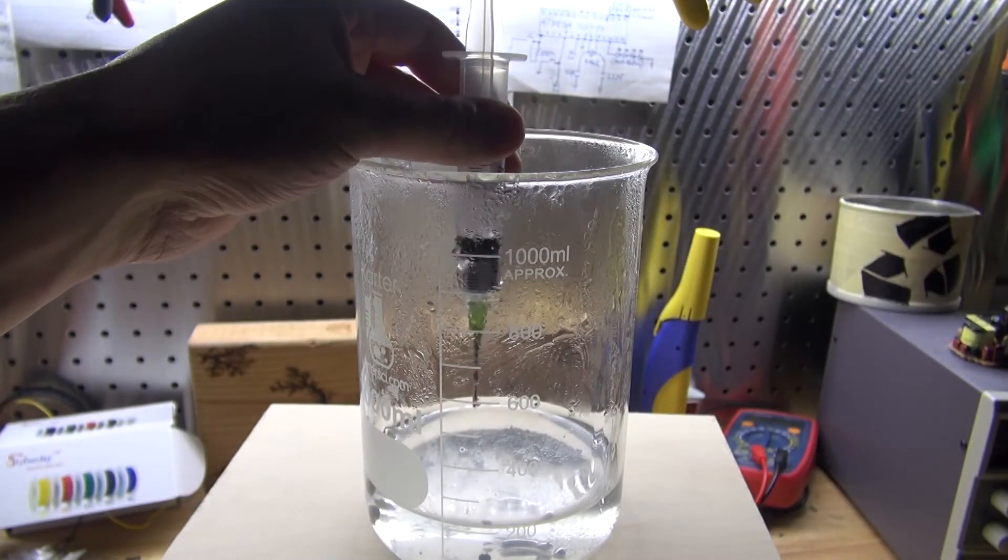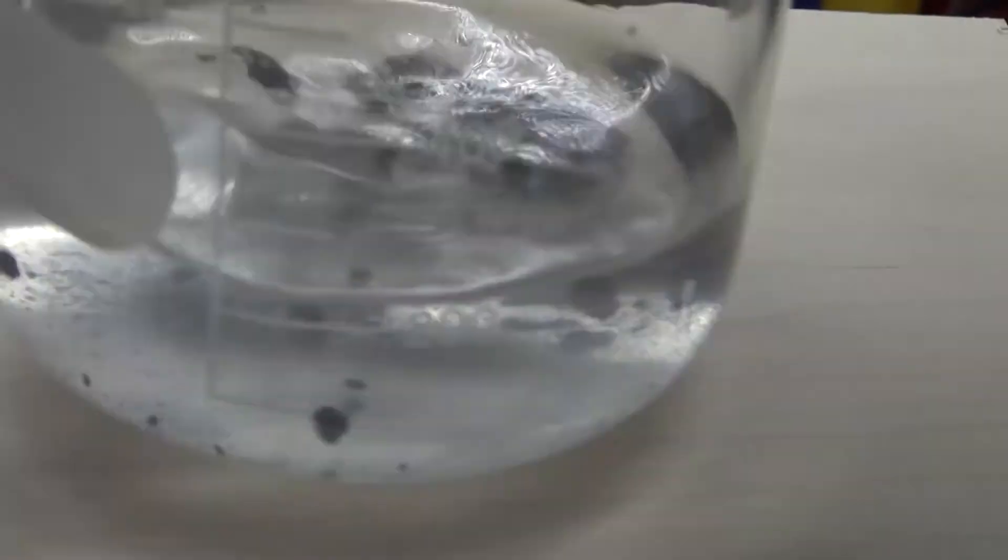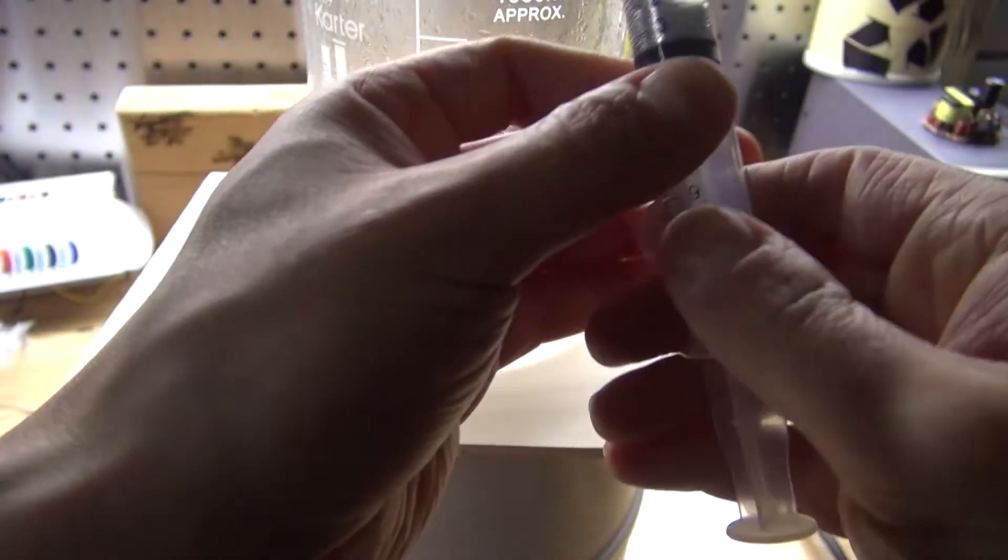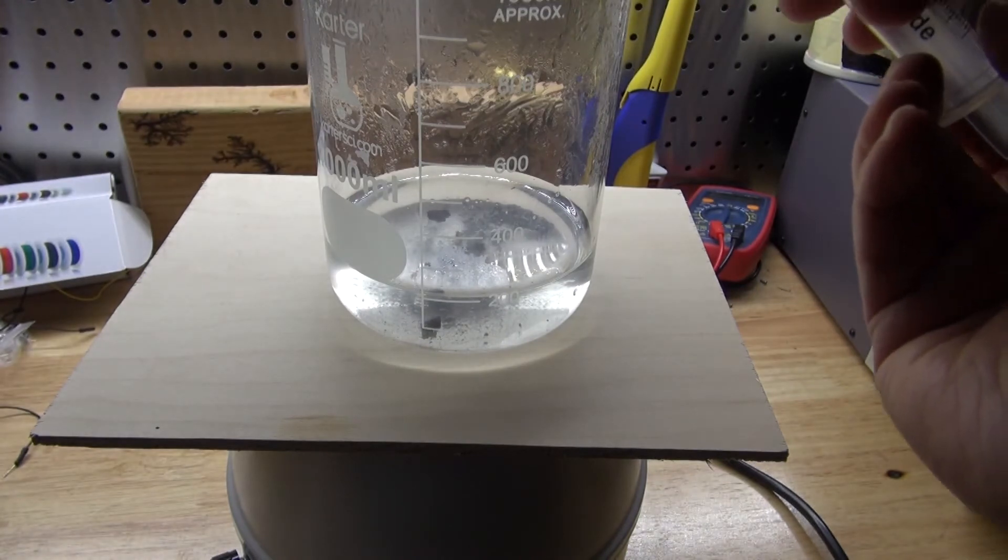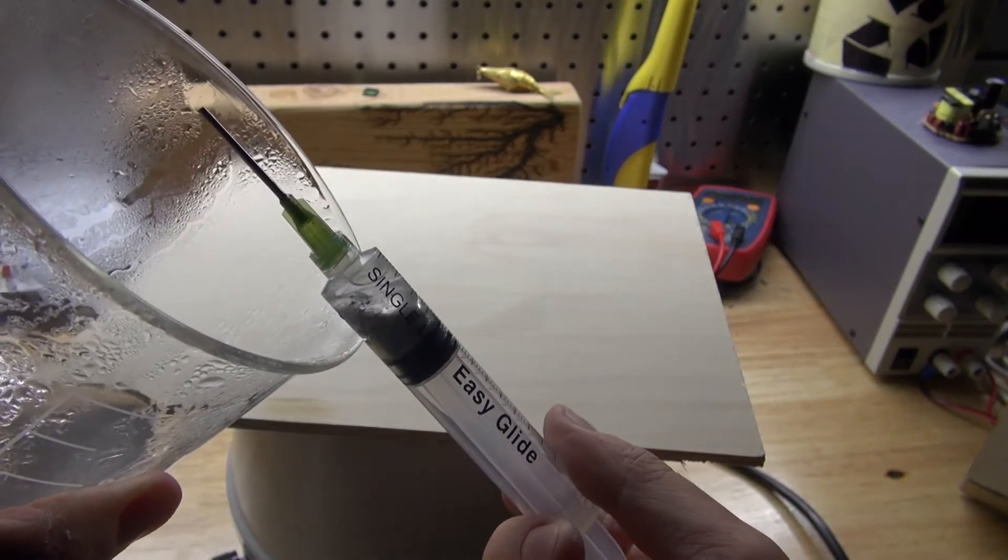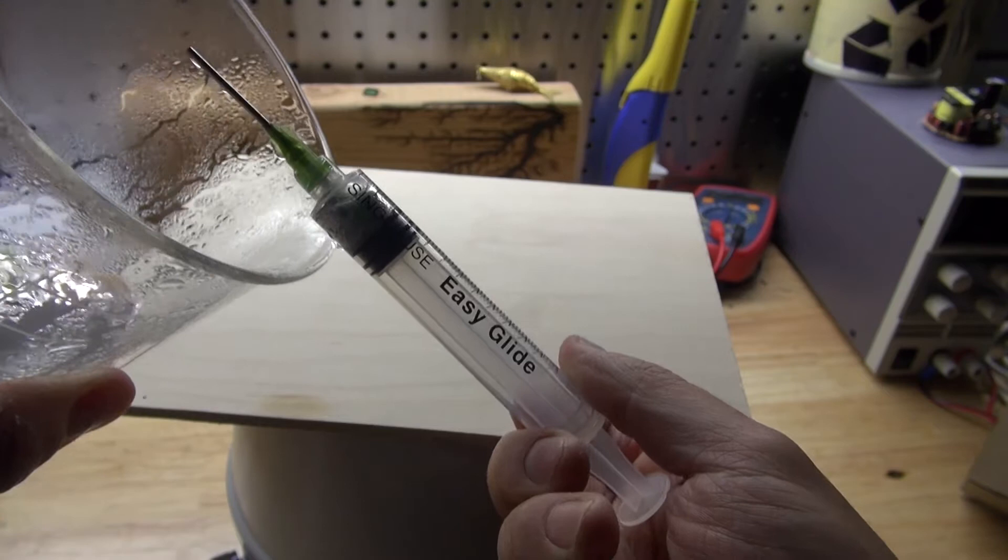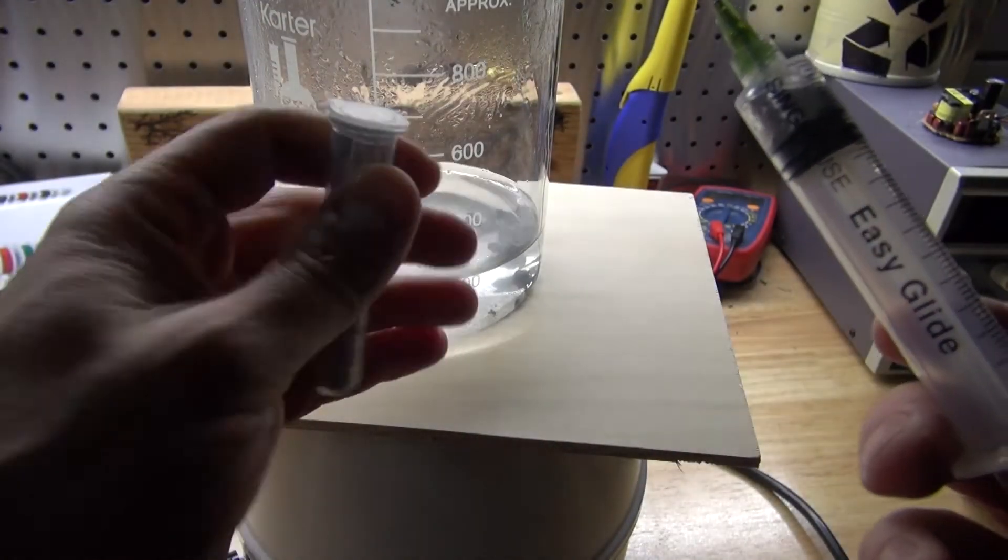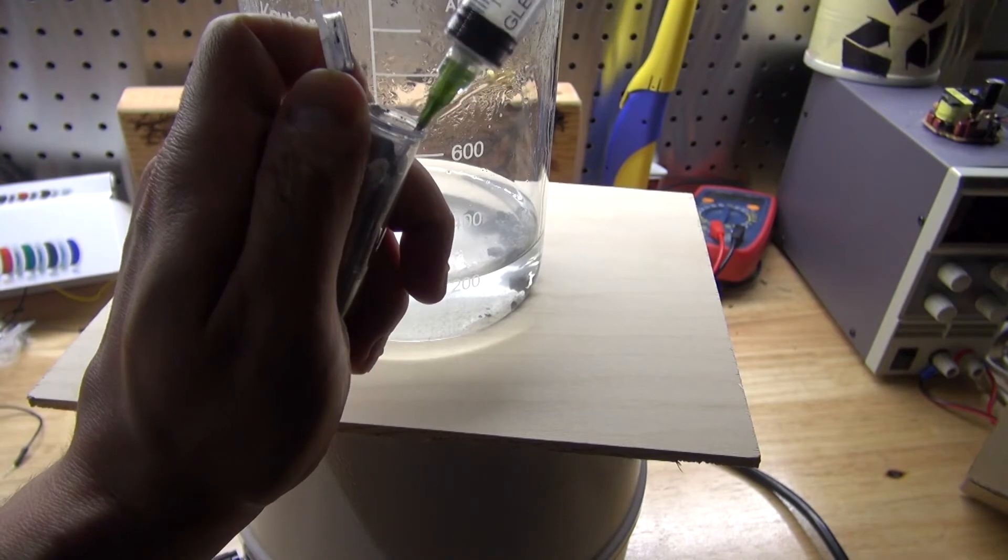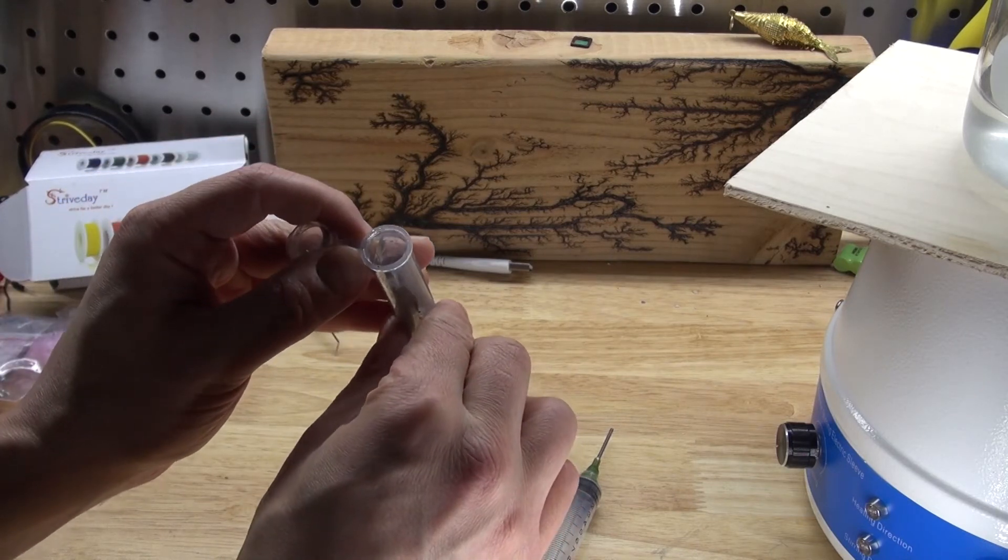Okay, attempt two. I'm going to get to what's left of the gallium. I'm going to do this quickly because I don't want the gallium to solidify in the plastic because gallium likes to stick to plastic. So I'm going to go ahead and try to carefully kind of go in this angle and squirt it all out. Squirt out all the water. There we go. Now I have my container that contained gallium before. I'm going to squirt the rest back in here. And there we go.